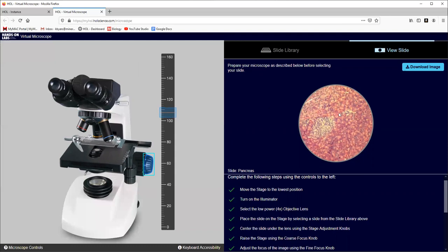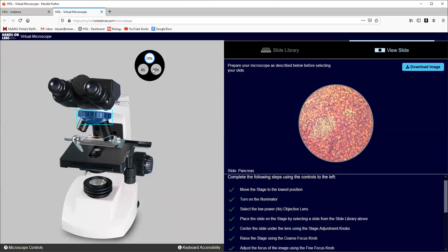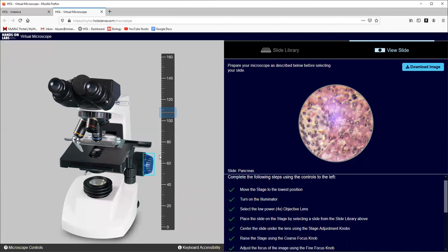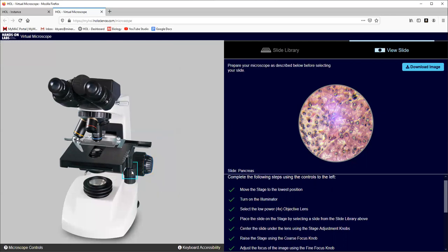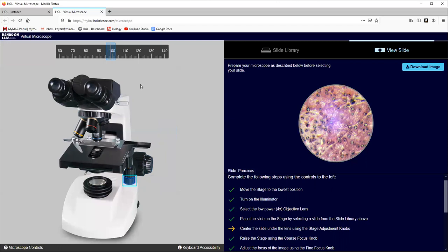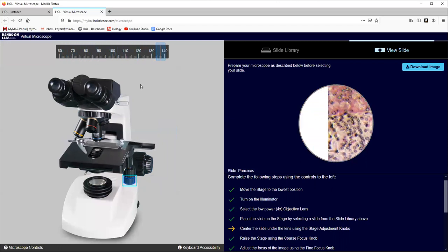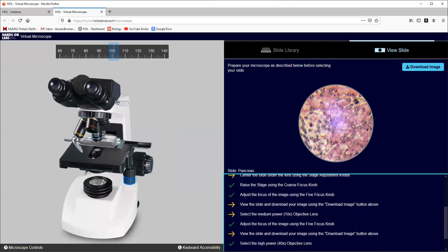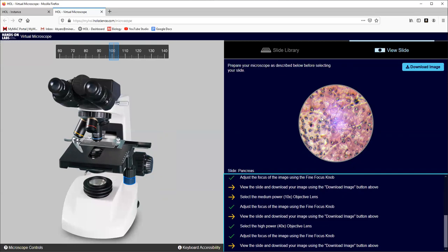Look, you can begin to see those cells in the pancreas. Let's go ahead and move to 40 times, the highest power on this microscope. It's a little blurry, so we'll use the fine adjustment and use our arrow key. And there we are. This is almost exactly what we would see in the classroom, just like this. Now, in the classroom, we could move the binocular scopes. We could move the stage. These two knobs down here move the stage either left and right or up and down. But you can move around on your image. When it says center the slide, I've not had good luck getting that green check mark on there. But so far from what I've seen, it hasn't stopped me from moving to the next step. And so I could download that image and then save that file and then upload it into my lab.